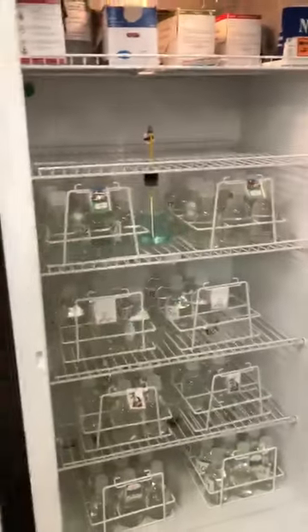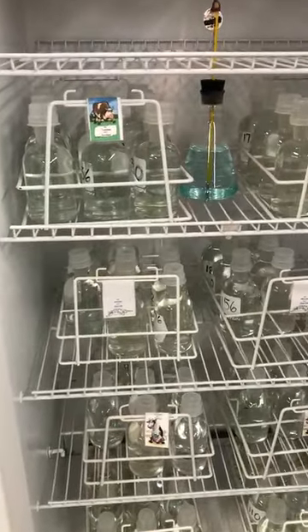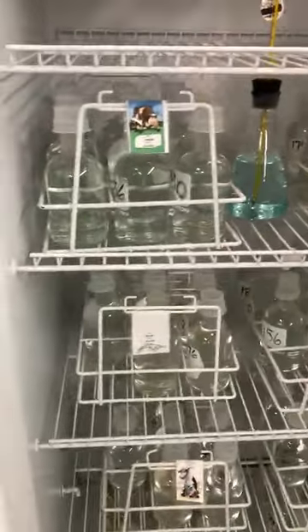We keep a bit of this after we do it. We keep it for five days in this incubator. We have all the days in here. We are going to take the one that says out today.